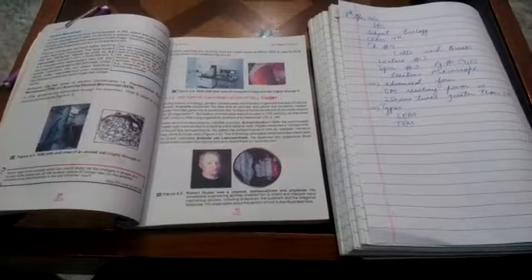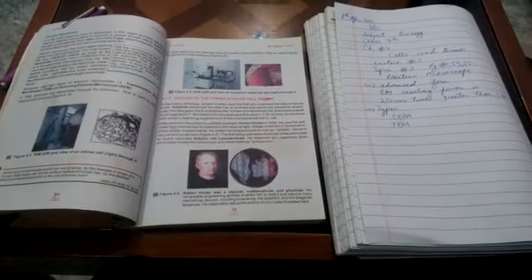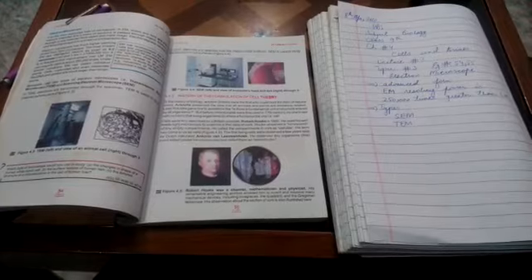The electron microscope is used to examine and see the smallest objects — even objects smaller than the size of a bacterium, which is 0.2 micrometer in size. In the electron microscope, the object and lens are placed in a column.